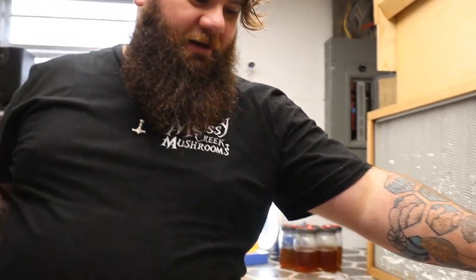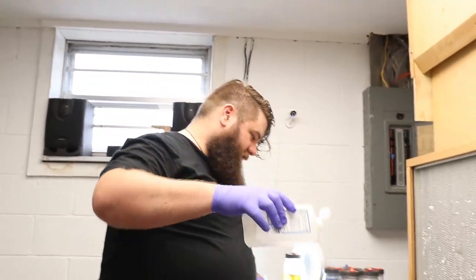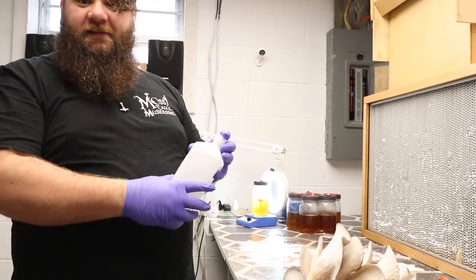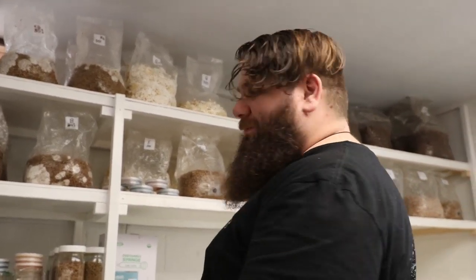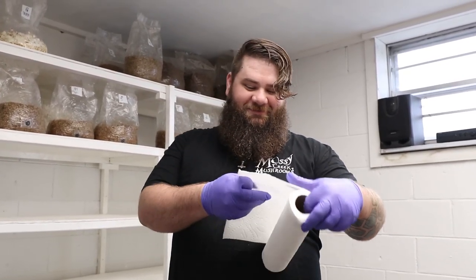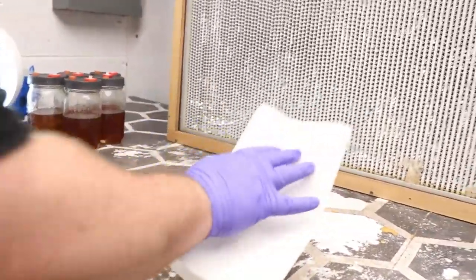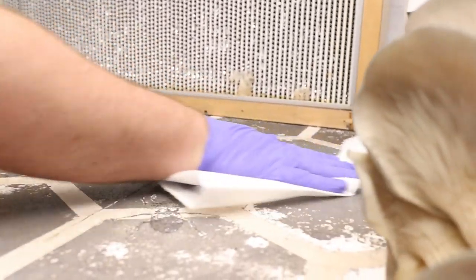Now I just got a cleaner space, and the way that I normally clean my space is just take my isopropyl alcohol, 70%, and just douse the table down. And yes, I know, I use way too much alcohol — even you medical professionals say that. Now just wipe it down from the hood back, working back and forth.